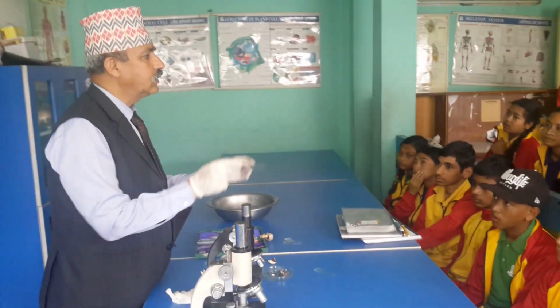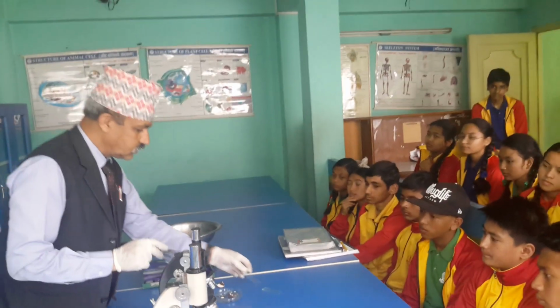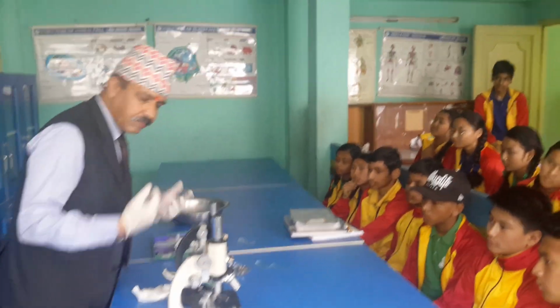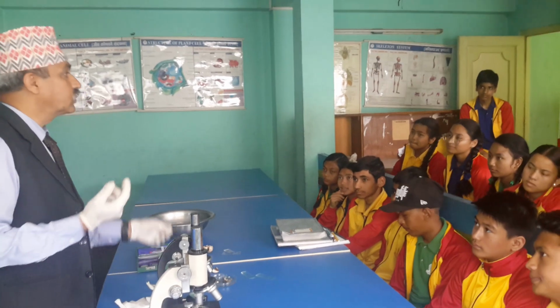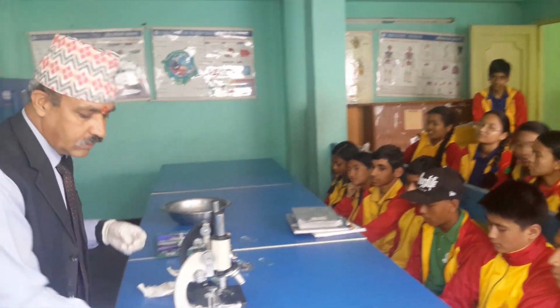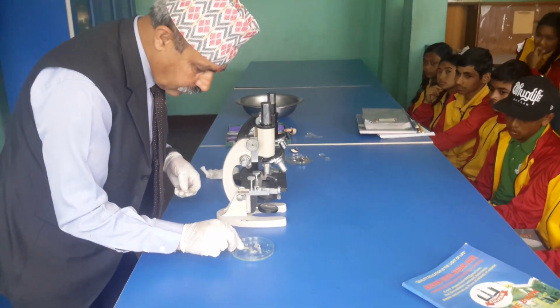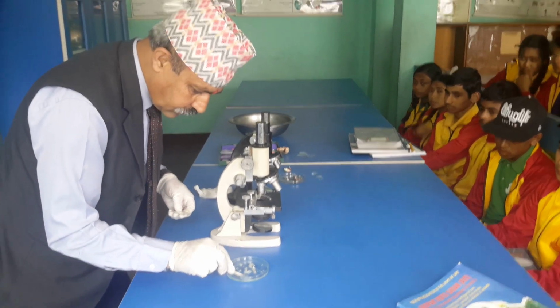I'm just making this one. Later on you have to do your own. Okay? Because you have to be champions. I became a teacher, but you may be a researcher in a science institute. Yes sir. But for that you must try yourself. Okay. Here also let me take this portion.